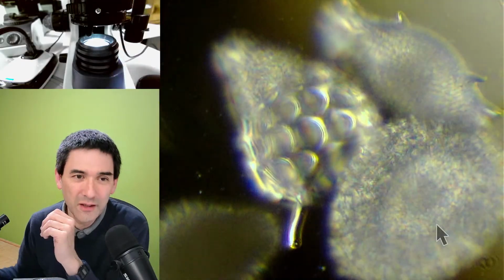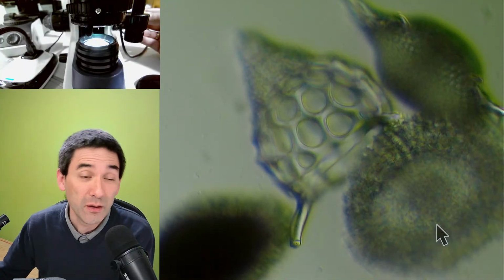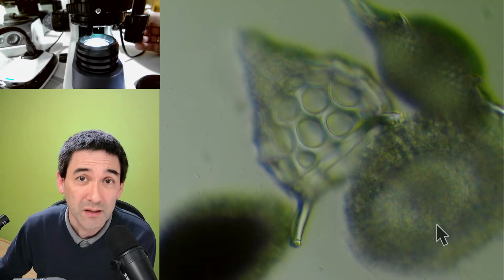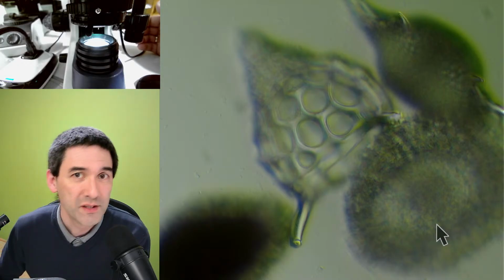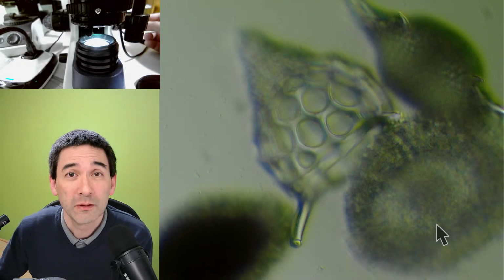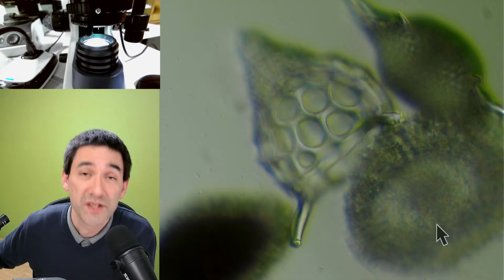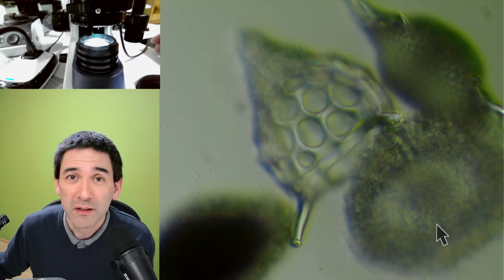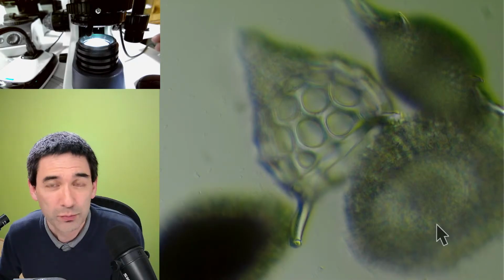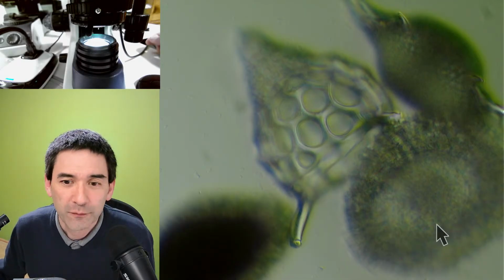Yeah, so quite nice. So why am I showing this to you as well? I receive not a few emails, or not only emails but also comments in the YouTube videos, from people who buy a microscope and then immediately say, okay, I want to improve it, I want to upgrade it, right? My recommendation is, before you invest any money in upgrading the optics, which probably won't make a huge difference anyway, I recommend that you play around a little bit with different types of filters.